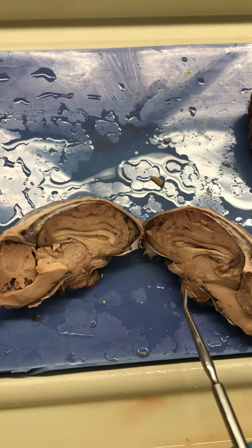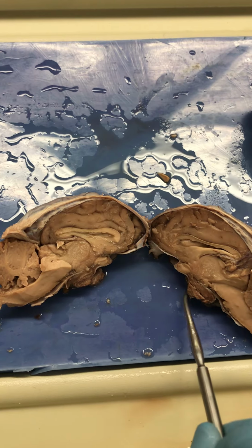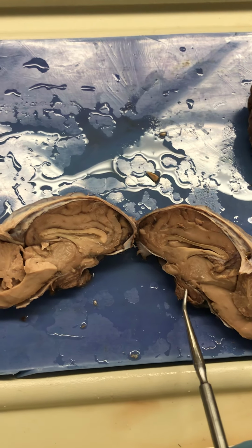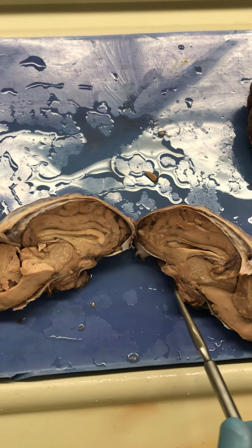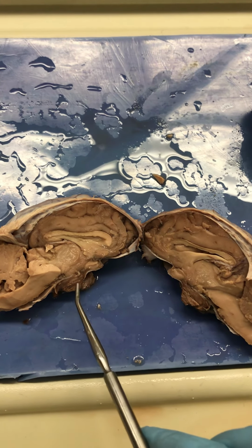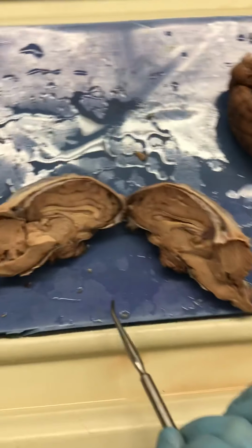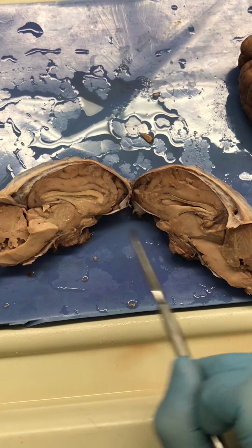And it is connected to the pituitary gland. The nice thing about the brains that have the meninges on them is the pituitary gland is still there. Look at the size of that thing. If you remember in the bones, we have the sella turcica that helps to house the pituitary gland. It rests in there because the hypothalamus and the pituitary gland work to support the autonomic nervous system and the endocrine system. So there you have it.